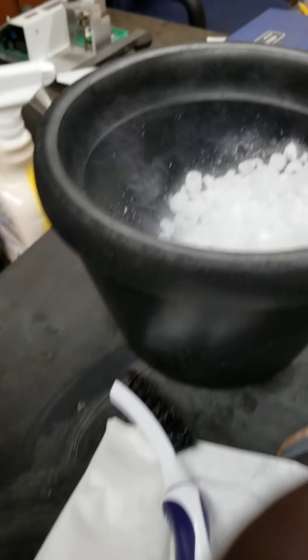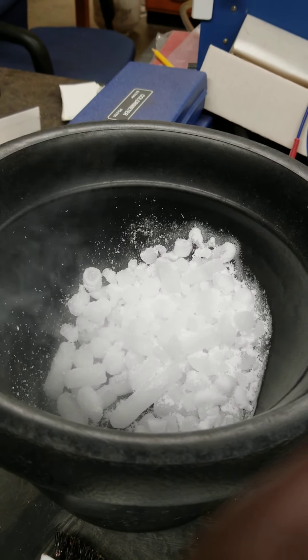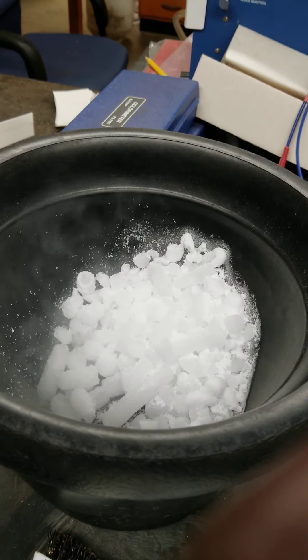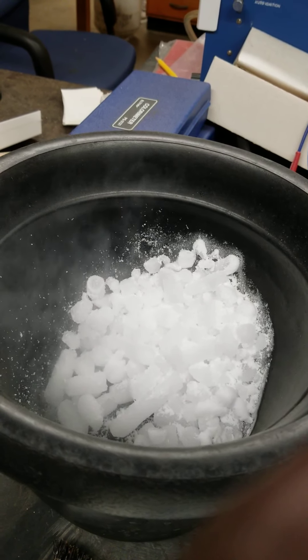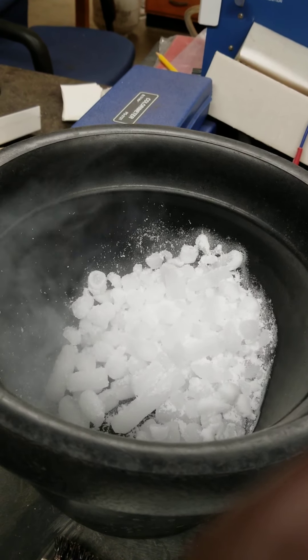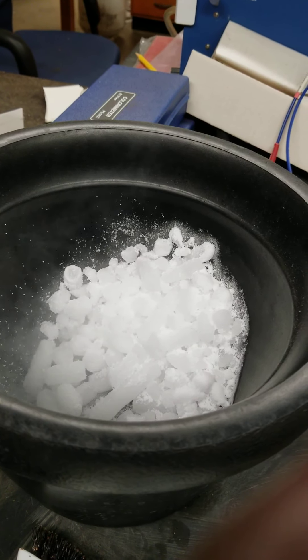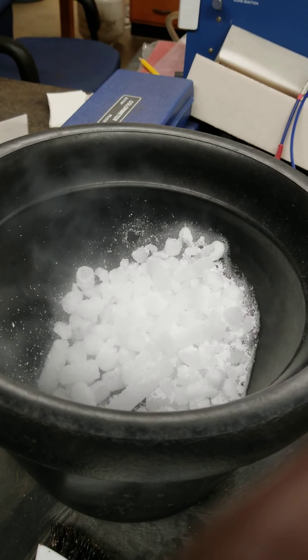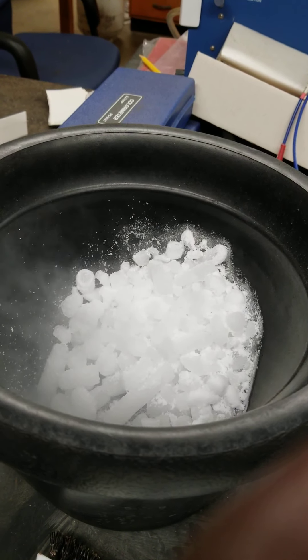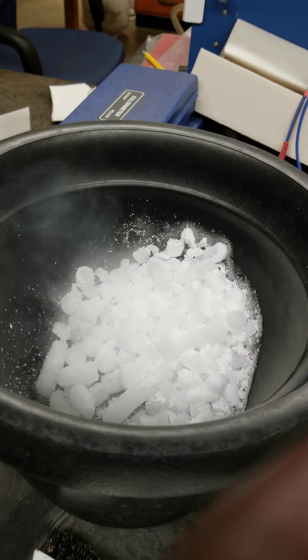Here's the dry ice. Note that you see some white kind of gas. Carbon dioxide is colorless, so I'll ask in the post-lab why we see some whitish stuff. What is happening is the carbon dioxide, which is really cold, comes out and comes into the atmosphere, causing us to view some gaseous stuff.